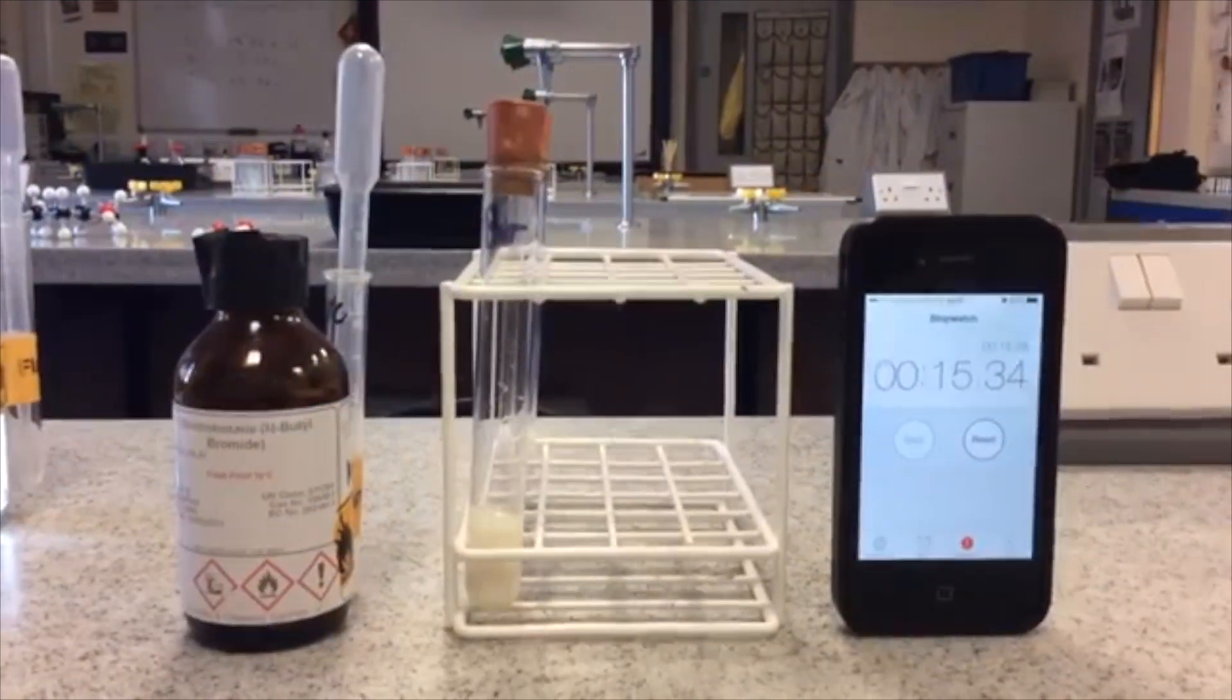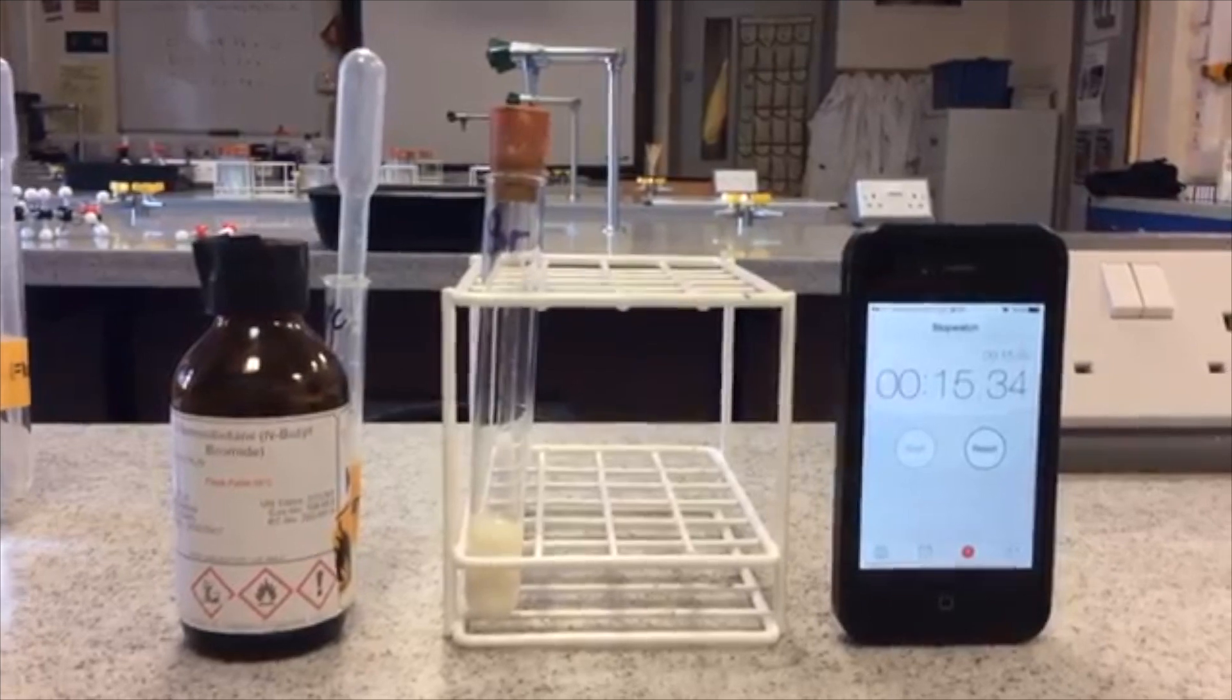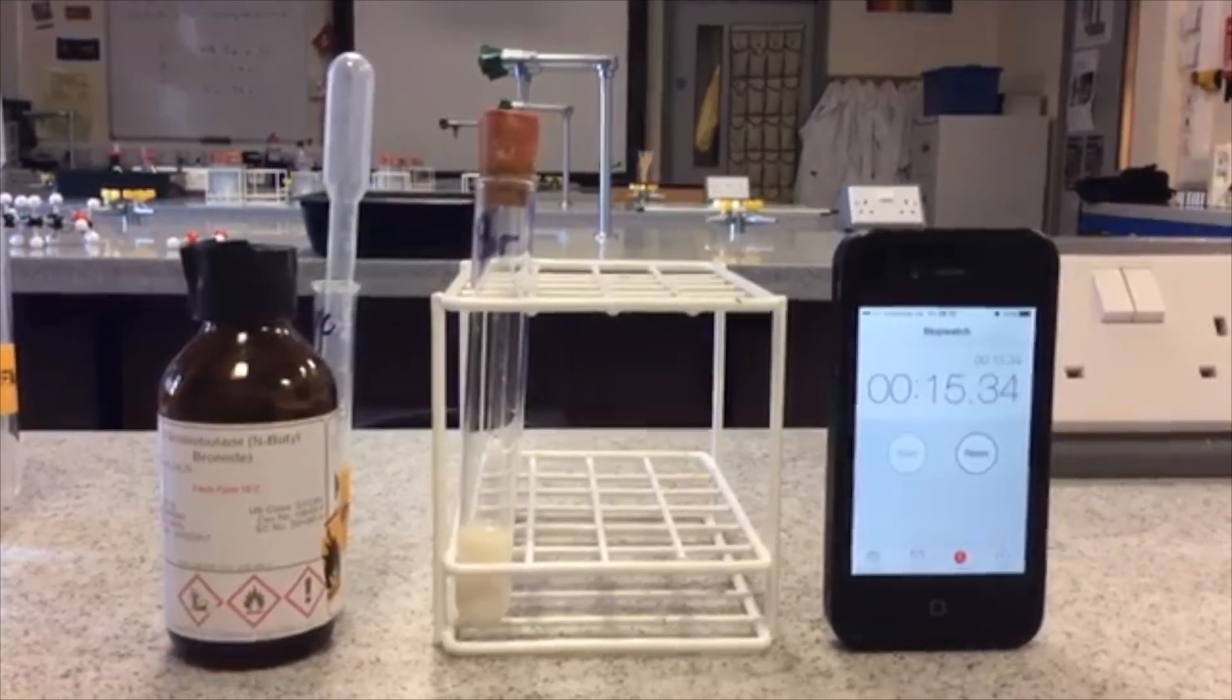There's the cream precipitate of the silver bromide, and that's taken 15.34 seconds.